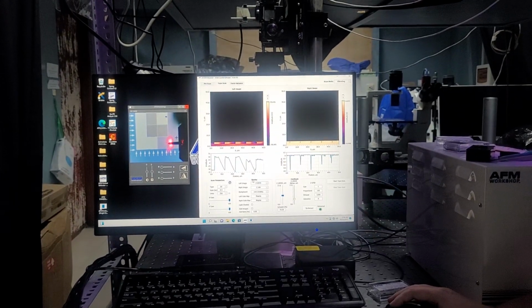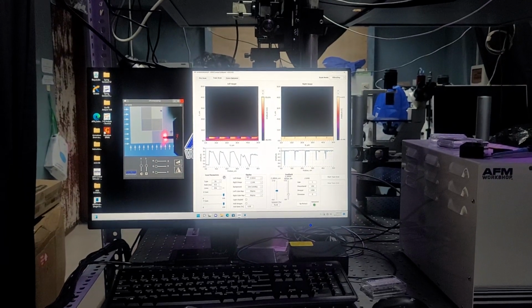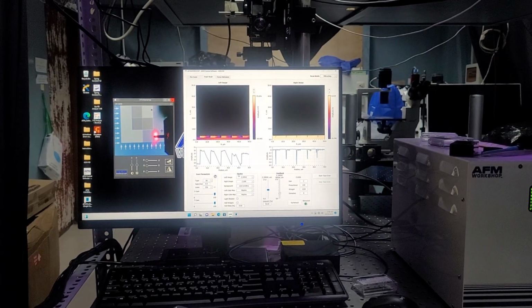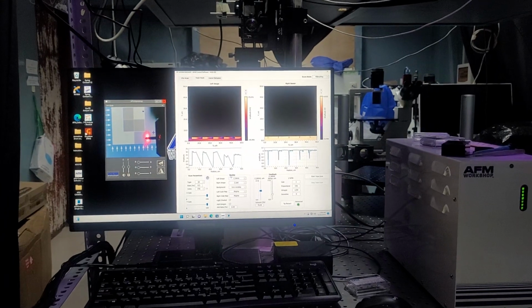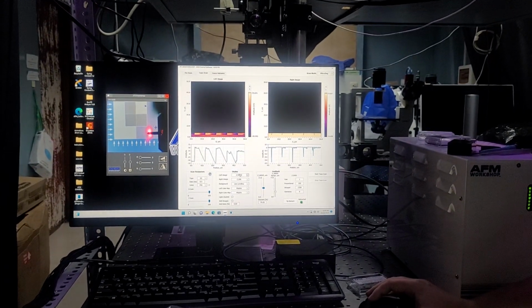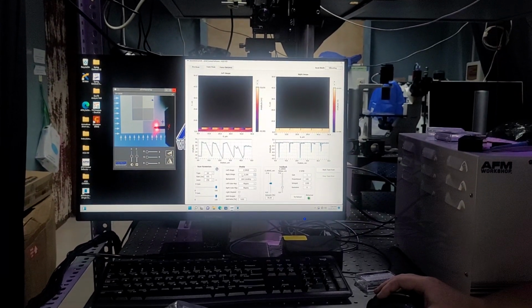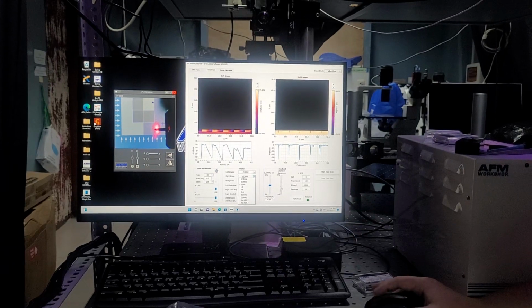Going over display, this is pretty straightforward. You have left image and right image. At any time, the AFM can capture 2 data channels. And so typically your left image will pretty much always be Z drive, or your topography, and then you'll adjust your right image. So you have several options.